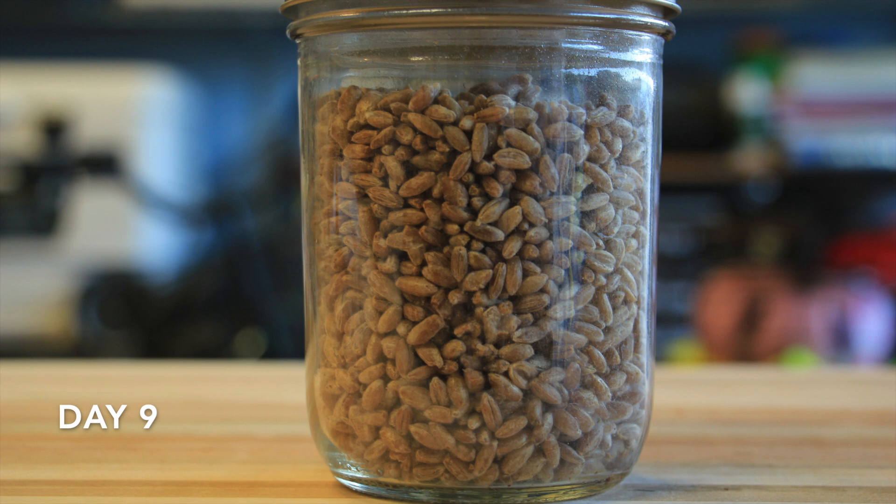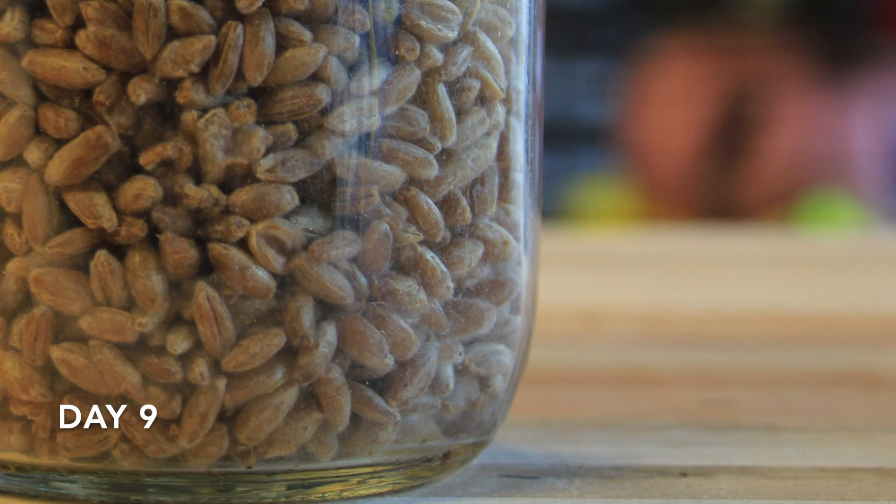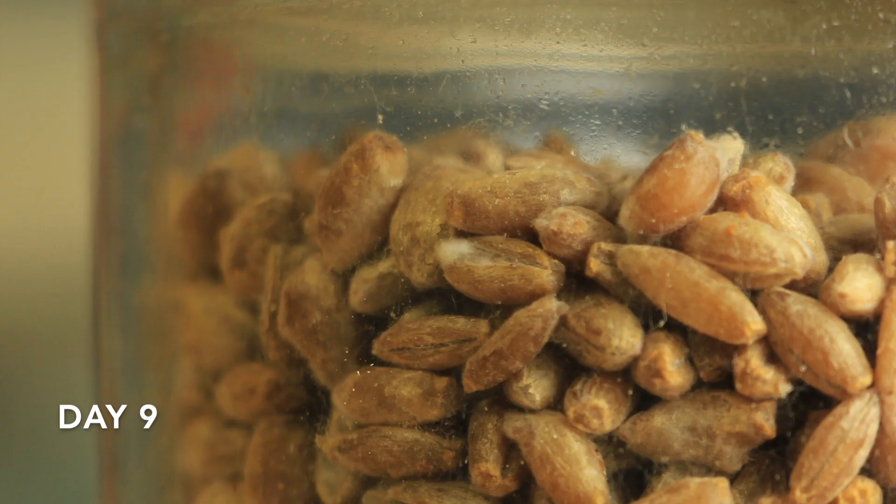You can see after the breakup the mycelium is not nearly as strong, but on day nine I started getting some more external puffy mycelium as you saw in that grain there.